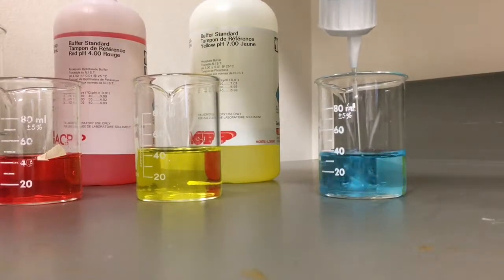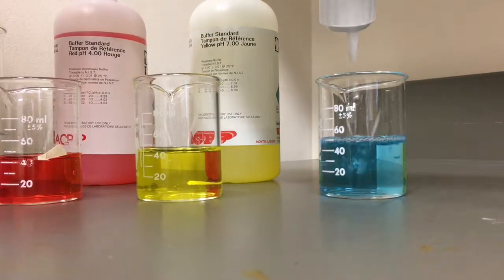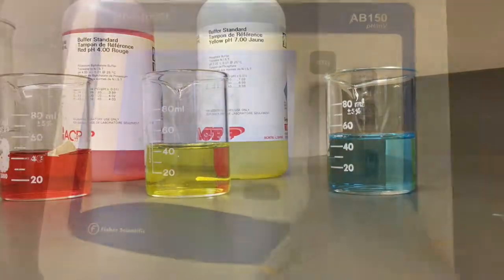To begin, using clean glassware, pour out enough buffer to completely submerge the probe tip. Do not reuse buffer solutions after calibration.